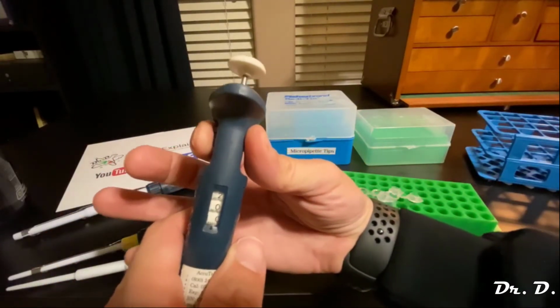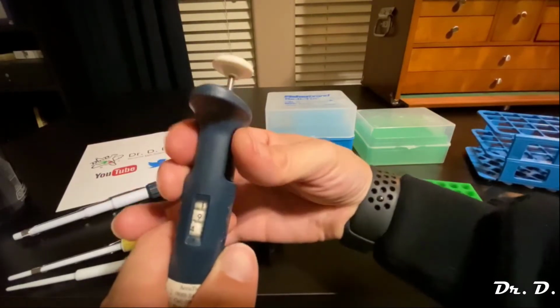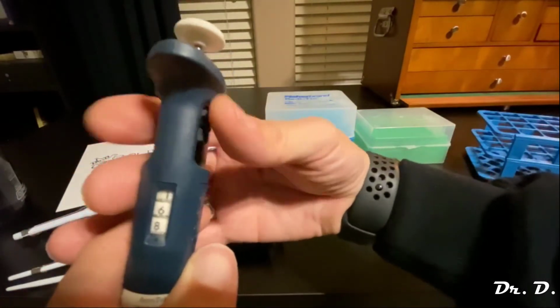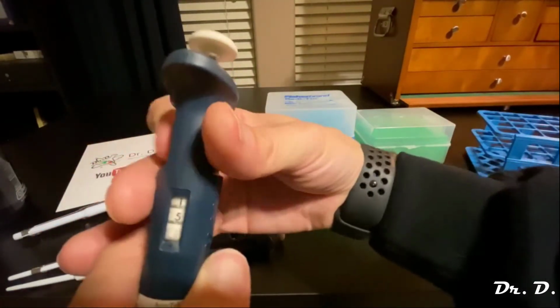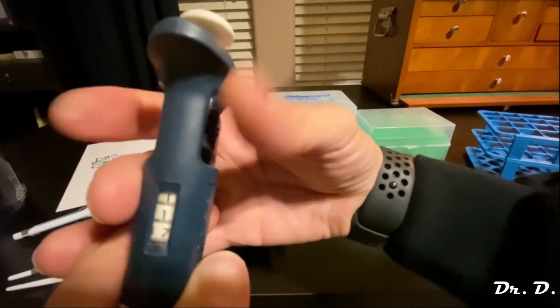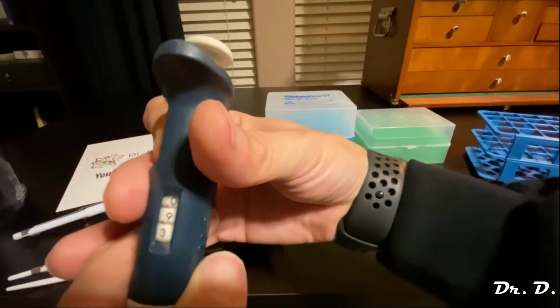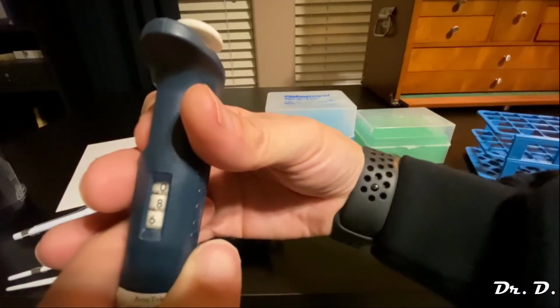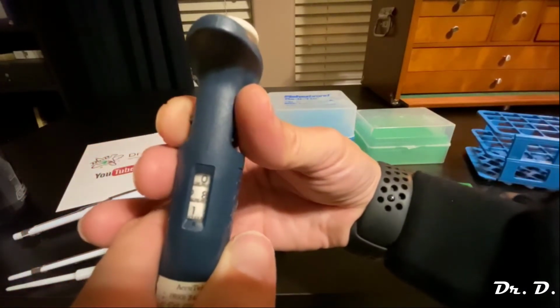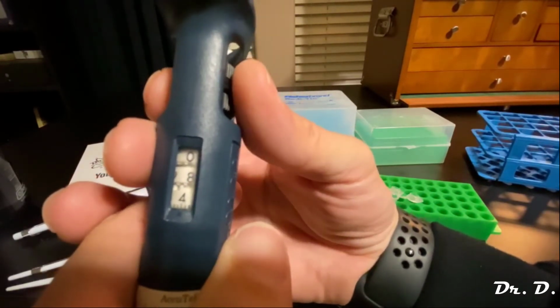Do I want to turn it so the numbers advance higher? No, I want to turn it so the numbers decrease, right? So I'm turning it in the 170s, 160s, 150s, 140s, 130s, 120, 110, 100, 90, and what did I say I want? 80. Let's say I want 84. Okay, so that would be 80, right? Let's say I want 84. How would I do that? 1, 2, 3, 4. There you go.